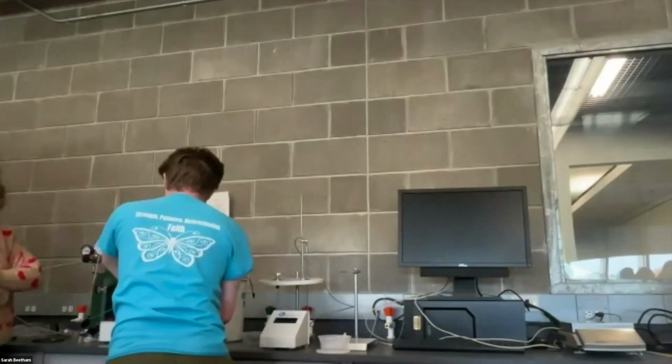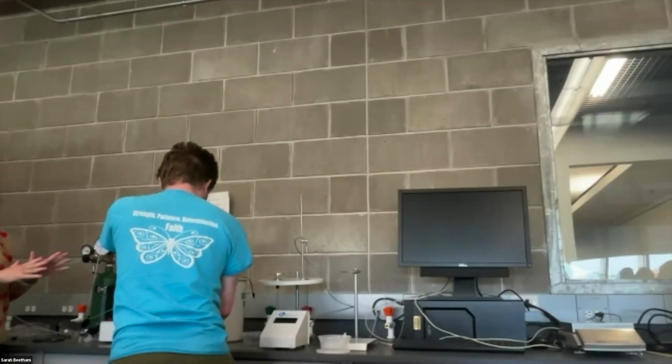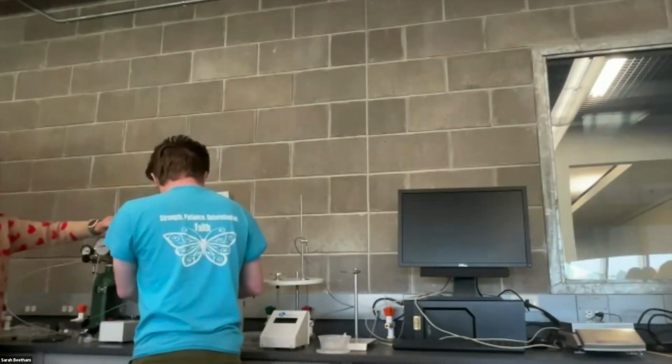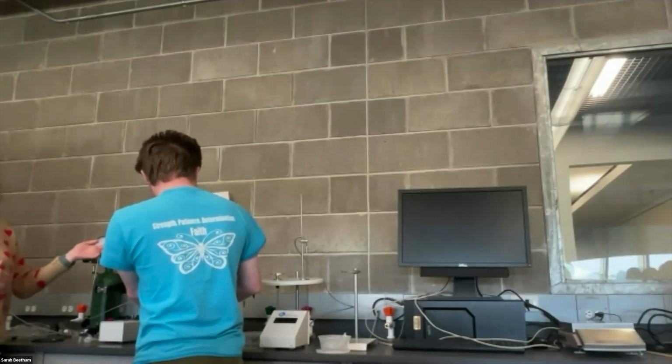This thing is pressurized to 25 atmosphere, right? So it is unopenable in this state. So what I'm gonna do, yep, you need to release, you can unscrew that to unrelease the, yep, you can open it more if you want. It's just like a pressure cooker, we're just letting off the pressure that's inside here, and that will let us open up the top.